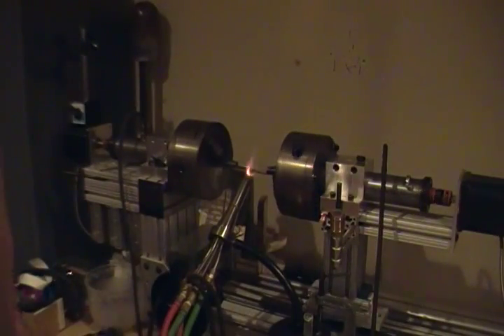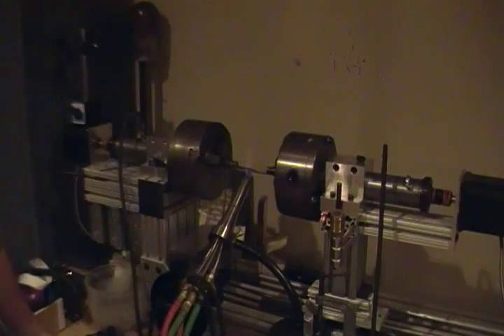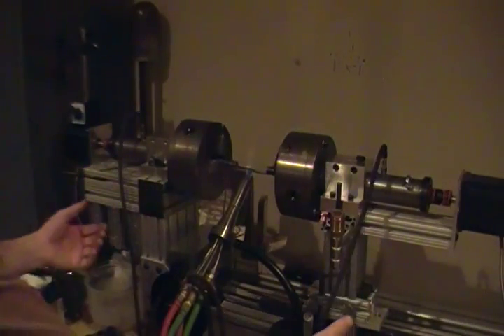Hi there, David Veidt. We're in my glass shop, and I'm about to fabricate a part out of quartz, and I just thought I'd show you how that's done. I have a piece of quartz tube chucked up in the lathe here on two graphite spindles. The graphite spindles have holes in them so I can pass air in these blow hoses.